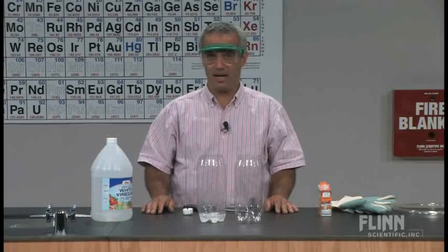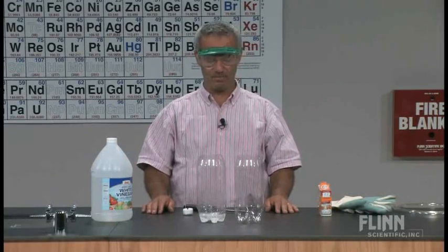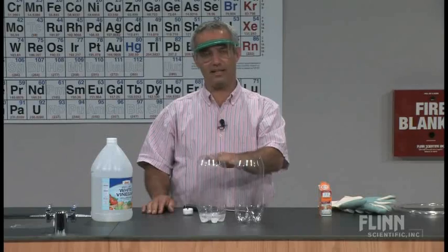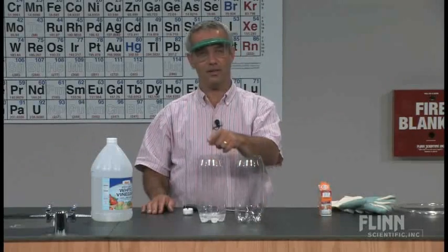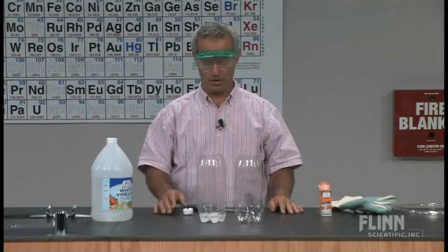Carbon dioxide is about 50% denser than air. If it is sitting in there like a liquid, you suppose I could maybe pour it from one container to another like a liquid. Well it's worth a try.